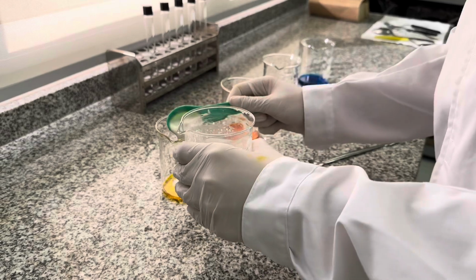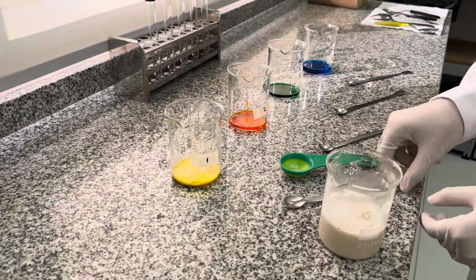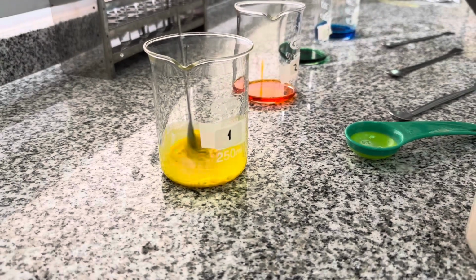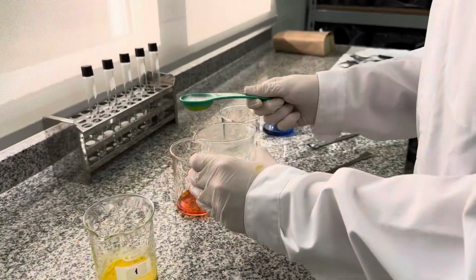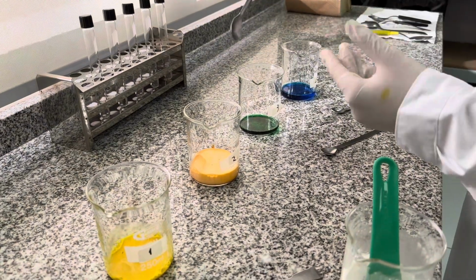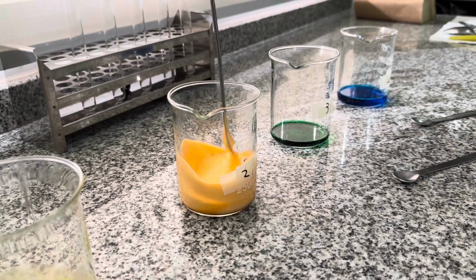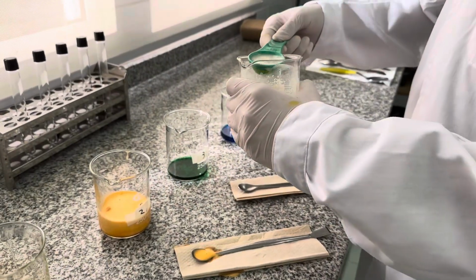In flask number 1, after adding 1 tablespoon of the dissolved yeast solution, there is no visible reaction happening. Since flask number 1 contains no hydrogen peroxide, there is no substrate for the catalase enzyme in the yeast to react with, resulting in no foam or other reaction products being formed. In flask number 2, after adding the yeast solution, we see some foam formation and bubbling. The catalase in the yeast reacts with 1/2 tablespoon of hydrogen peroxide, breaking it down into water and oxygen. The oxygen gas produces foam, indicating that a reaction is taking place.